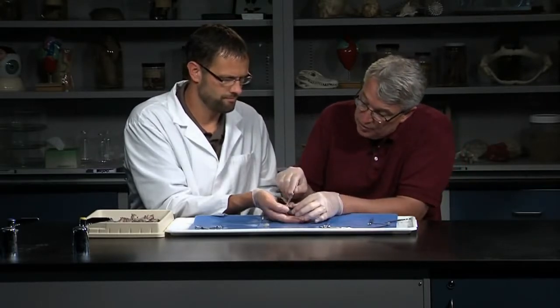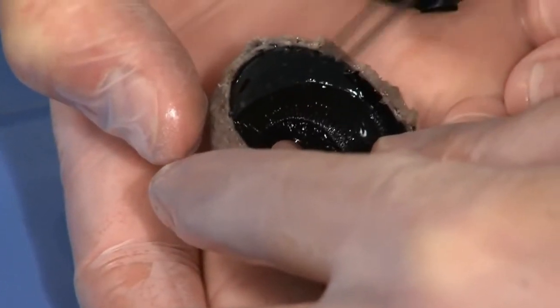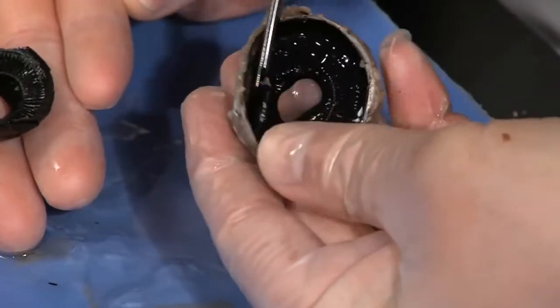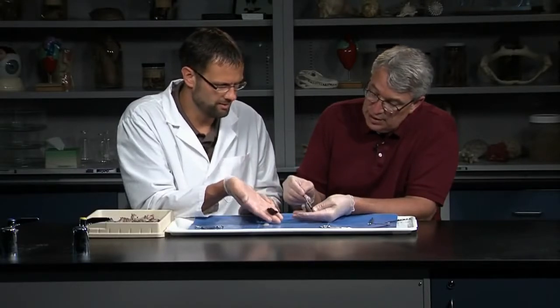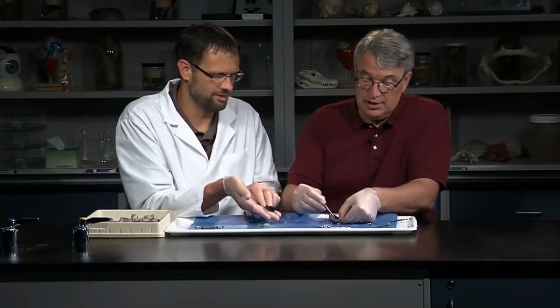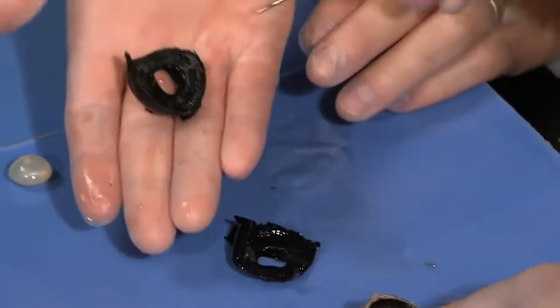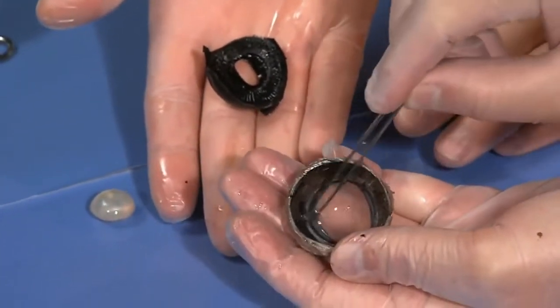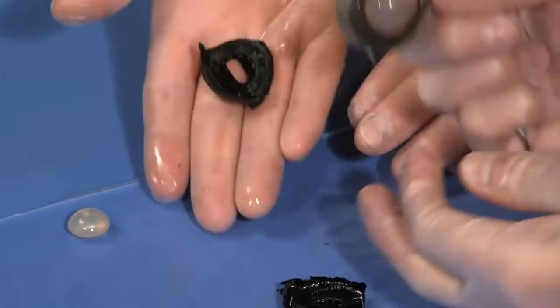Once you've looked at all those structures, you can remove the lens. Once you get it loosened, you can pull that out. You can remove the choroid — you can see here's the ciliary body, and it's continuous with the choroid. When you take that all out, the sclera is left. You can see where the scleral coat — the sclera — is continuous with the cornea.